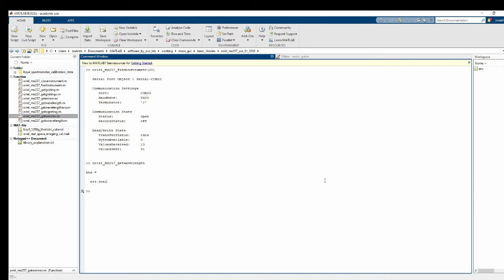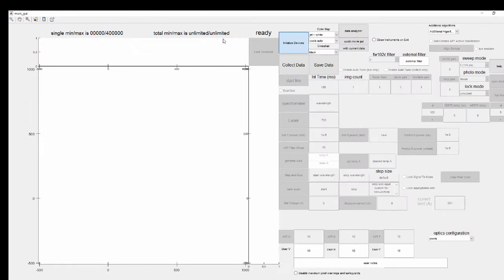So what we want in main GUI, we want to add two new buttons. There will be a button right here that says white light filter and a button next to it that says wavelength, and we can basically control it just like a spectrometer, because it is a spectrometer, where we can set the wavelength, press the button, and then it'll change the spectrometer settings so that only that wavelength of light gets through.